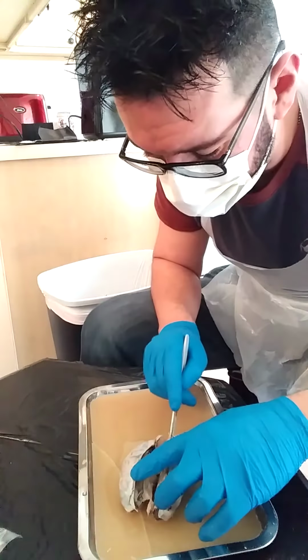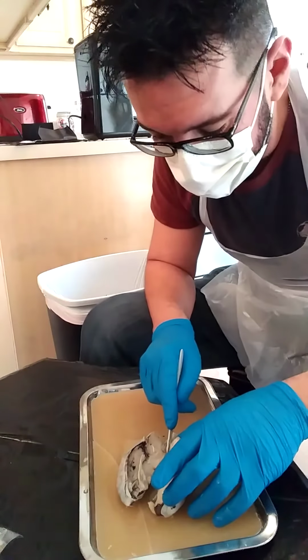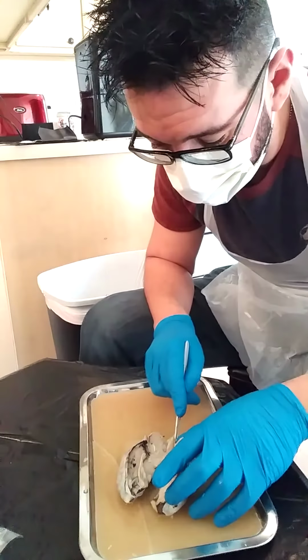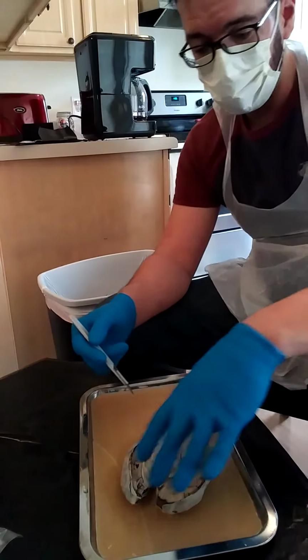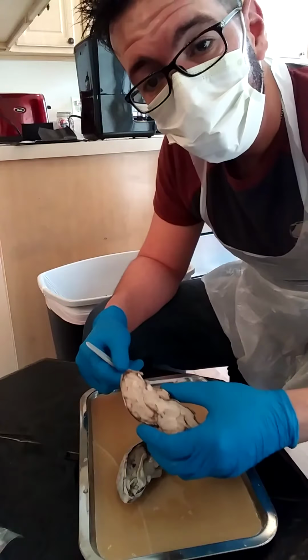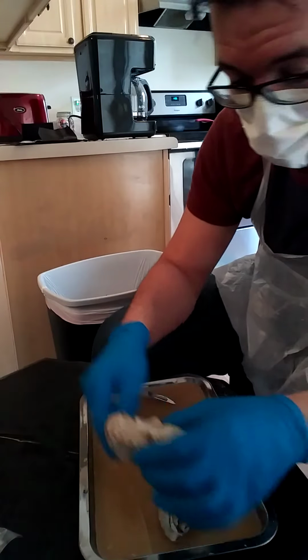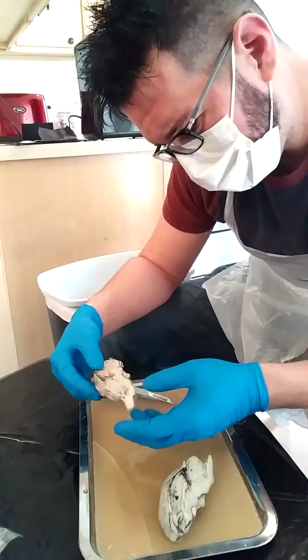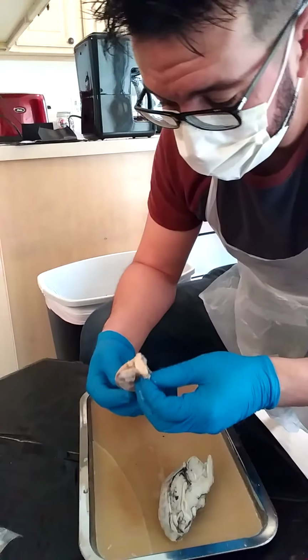Out of curiosity, I always wondered what the black part inside of the brain was. It looks something like plaque. I'm not sure what it is, and I don't think I saw what it was anywhere in the books. Okie dokie. So we have now split the baby, so to speak. Let's start from there. Actually, let's also get rid of this as well.